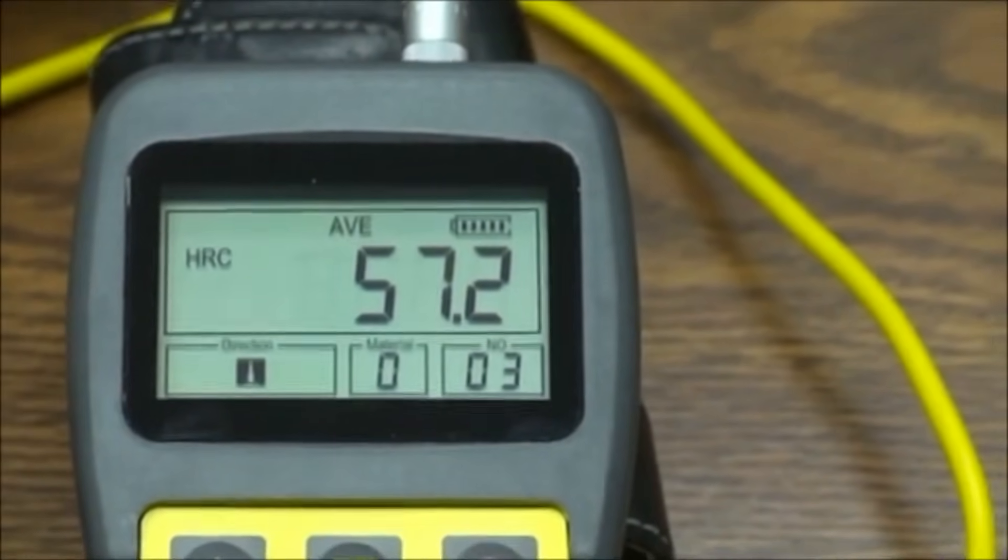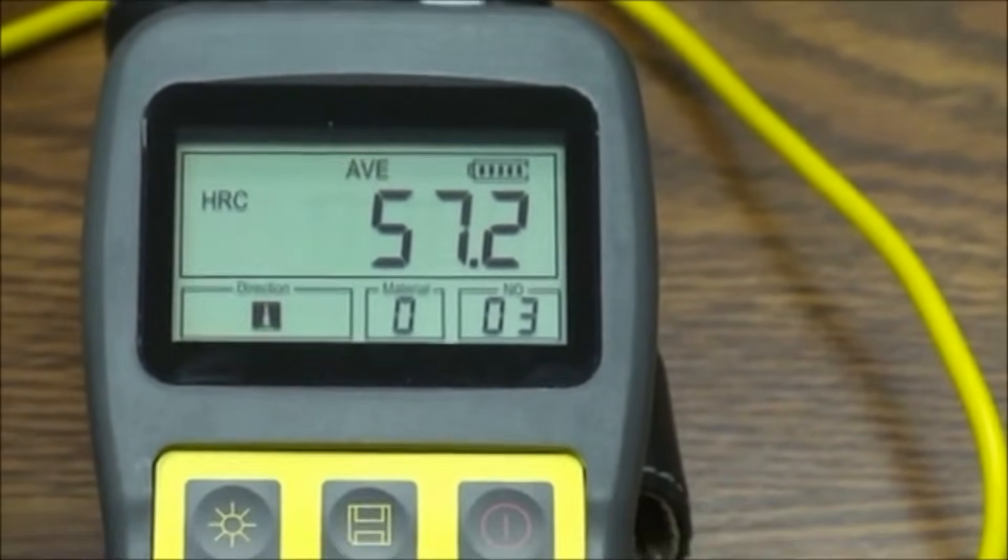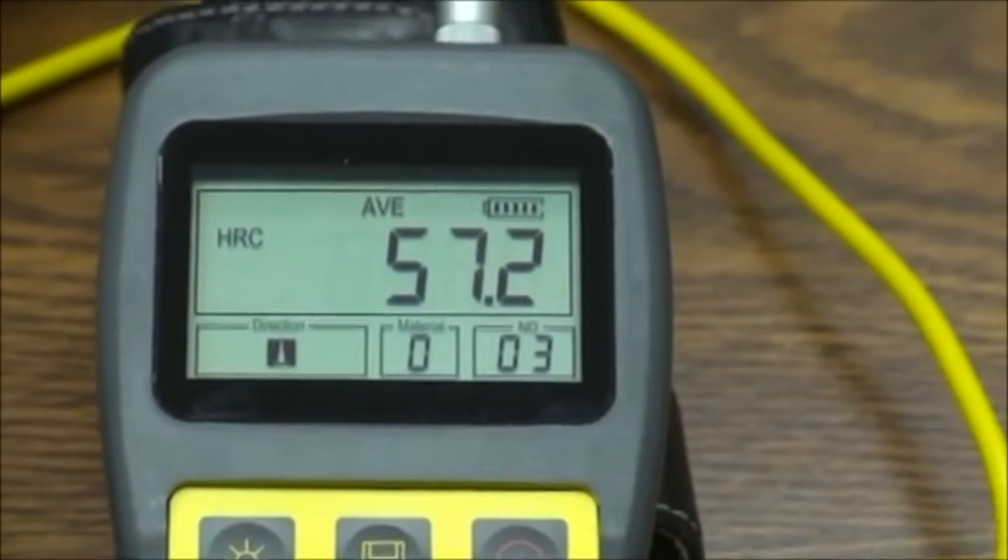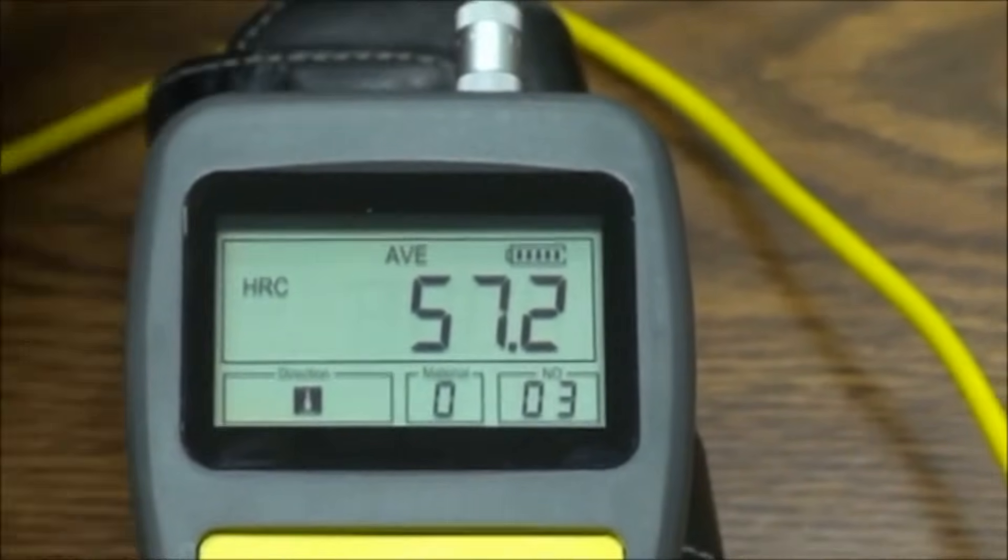At that time, then an average will show on the screen. Taking a series of quick burst tests are rather simple and easy.